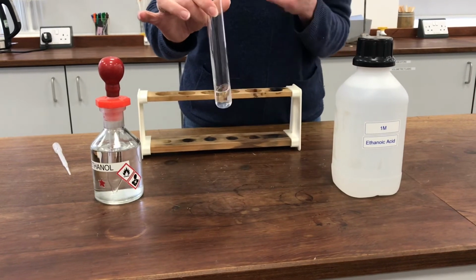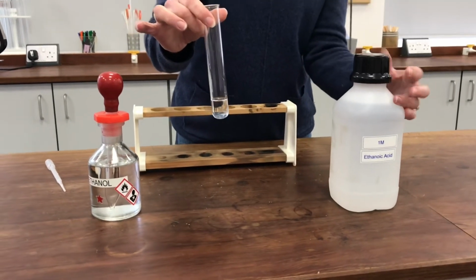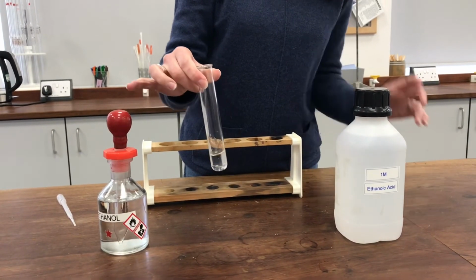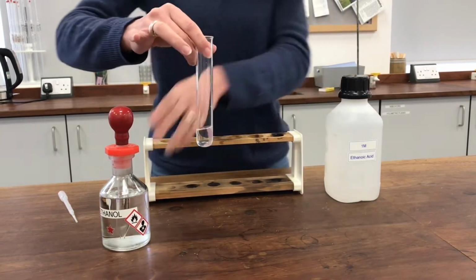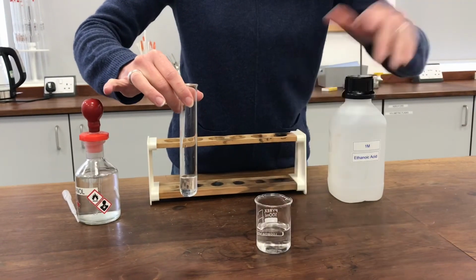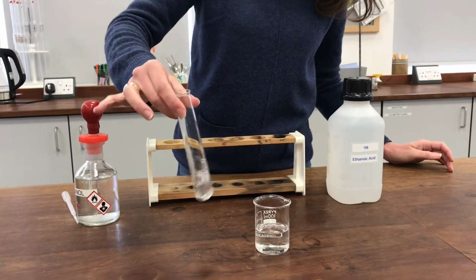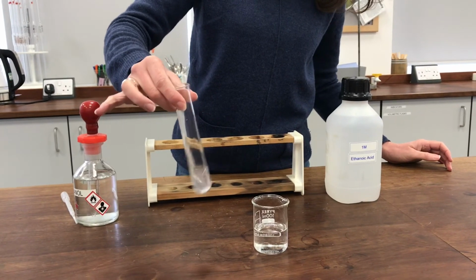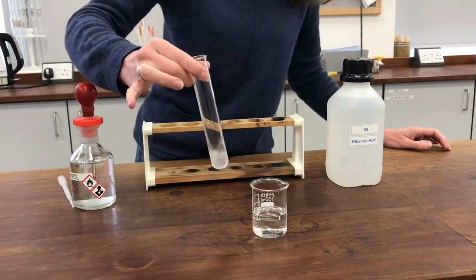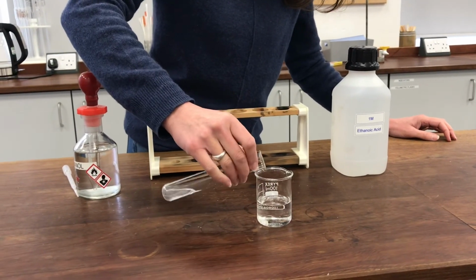I don't want to smell it just yet because I think it's got quite a lot of acids in the mixture there, and I don't really want to be breathing those in. So what I'm going to do is to pour this mixture into some sodium hydrogen carbonate solution, and that should neutralise any of the excess acids in the reaction mixture, and at that point I should be able to smell it, and it will have a very distinctive smell to it. Let's try pouring it now.